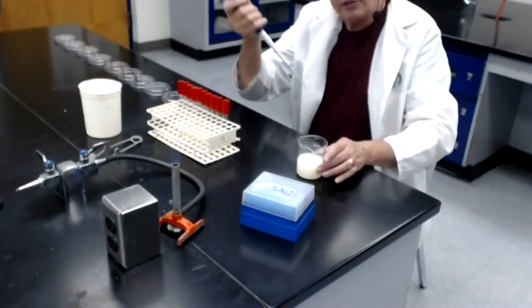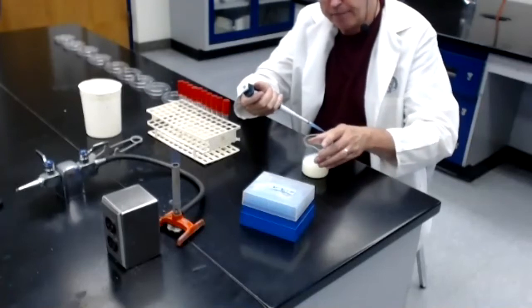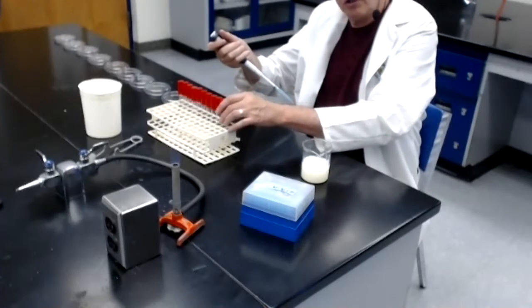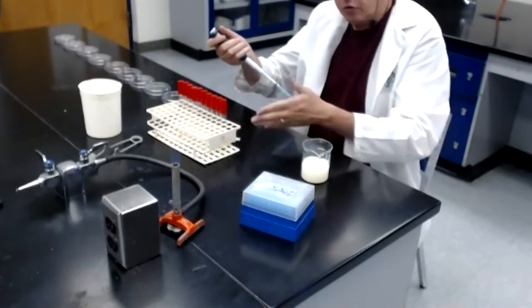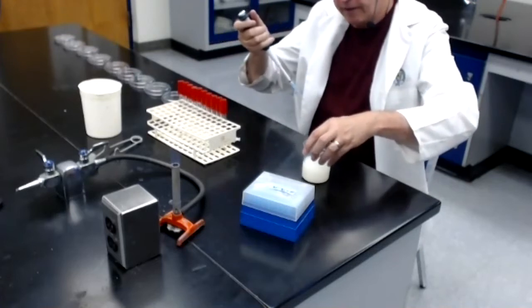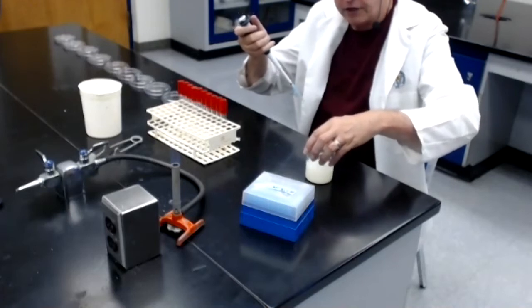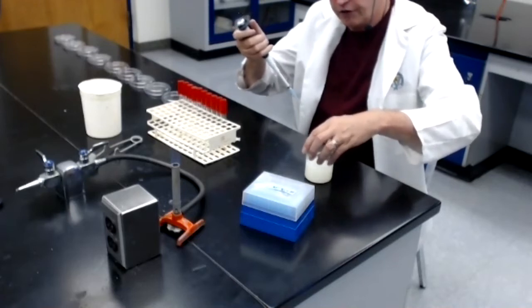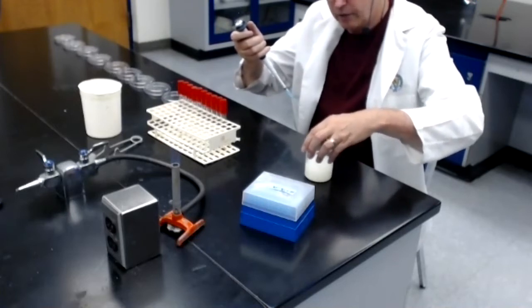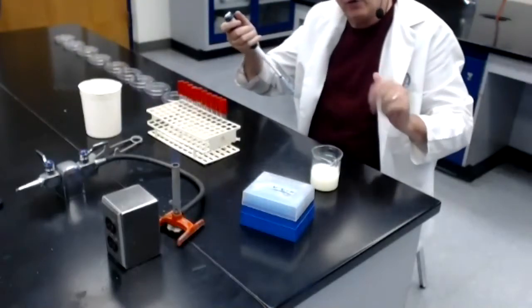And now what I need to do is use this pipetter to pick up a milliliter of the original sample and then transfer that milliliter to the very first dilution tube that is labeled 1/10, tube number 1. Now, I want to make sure this milk sample is adequately mixed. I gave it a good mix before I turned on the camera. But just to be sure there hasn't been any real settling out, I'm going to give it a little bit of a swirl. I don't want to slop it on the bench because it is contaminated milk. Okay, it's probably adequately mixed.